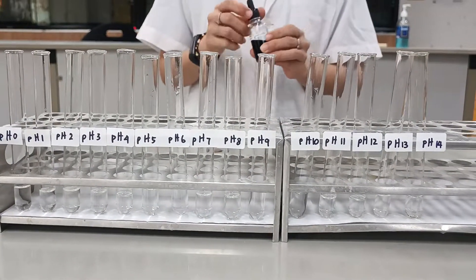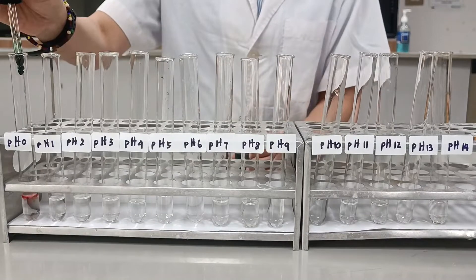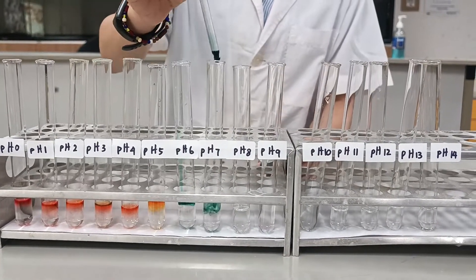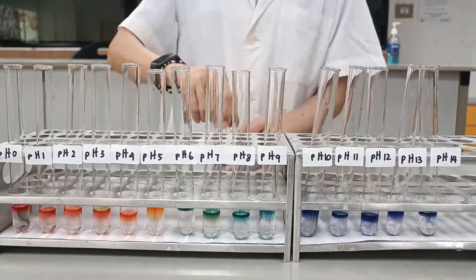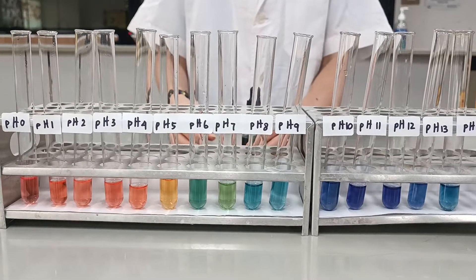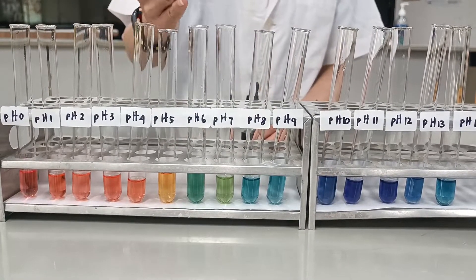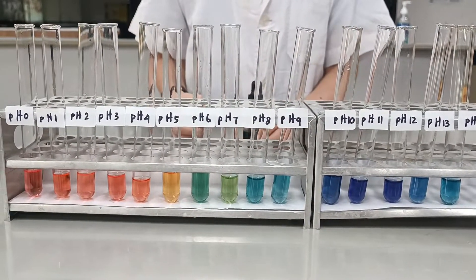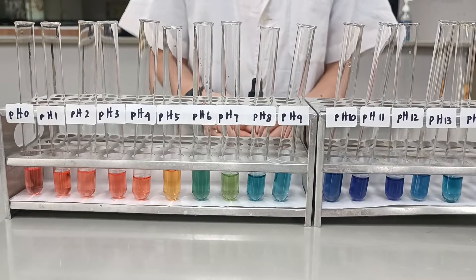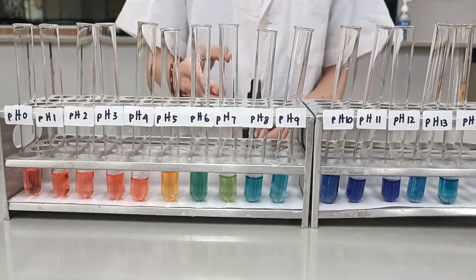The next indicator is universal indicator. This is available in paper or in solution and the indicator can tell us approximately what the pH is of our solution. Universal indicator has a similar color range as a rainbow, so it's very easy to memorize. It goes from red, orange, yellow, green, then blue, then purple on the higher pH area. Because the color changes at almost every pH level, universal indicator can be used to indicate the pH of a solution. However, it does not have a very clear endpoint because it changes color many times, so it is not suitable to be used as an indicator in a titration.